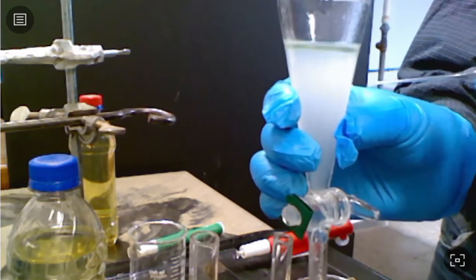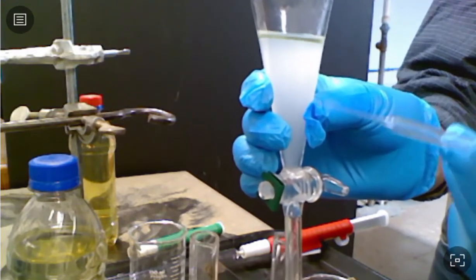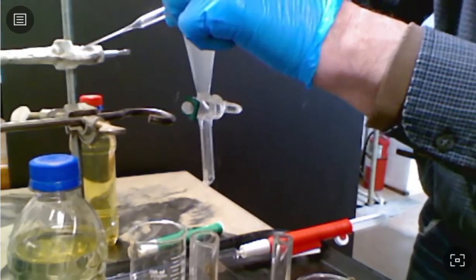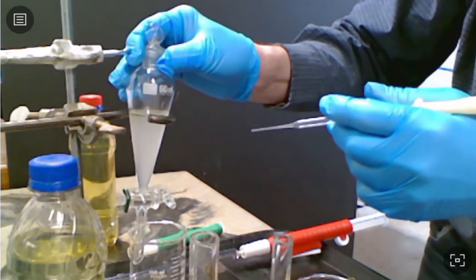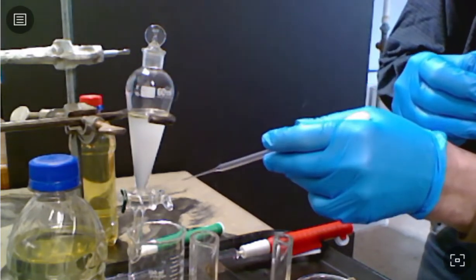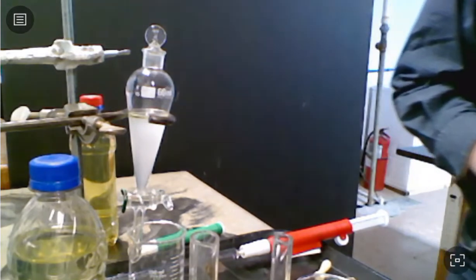in this layer. And the cool thing is that whereas before that layer was just water and clearly not flammable, now we have moved a lot of ethanol in there. And as long as we have more than 40% ethanol in that layer, we'll be able to ignite it. So we're going to take about 15 minutes and allow this to sit and see if we can get the cloudiness to dissipate. We'll see if it will clear up. And after that time, then we'll pull off the water layer and separate it in its own graduated cylinder, and then we'll collect just the gasoline layer. So we'll stop for 15 and come back to it.